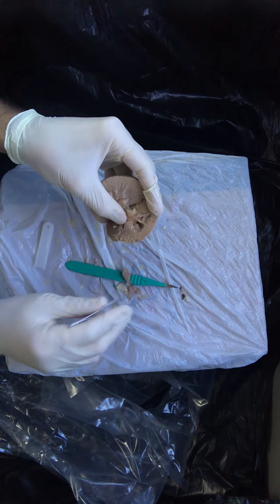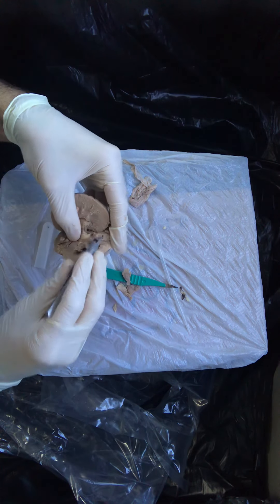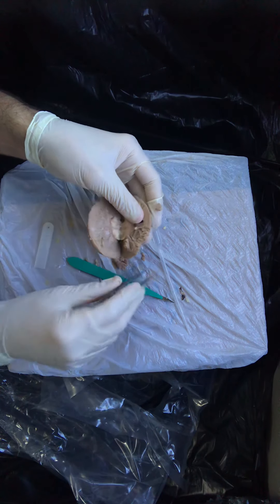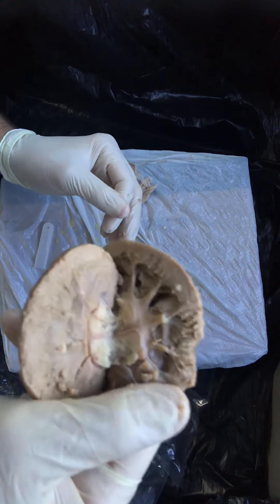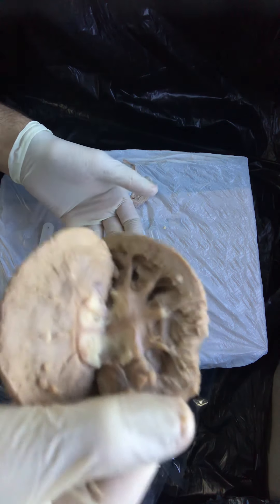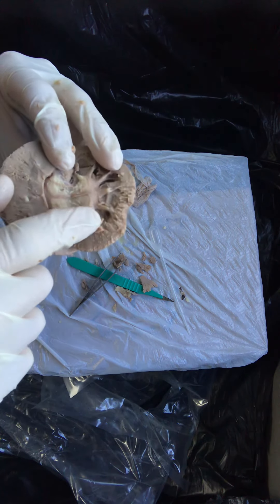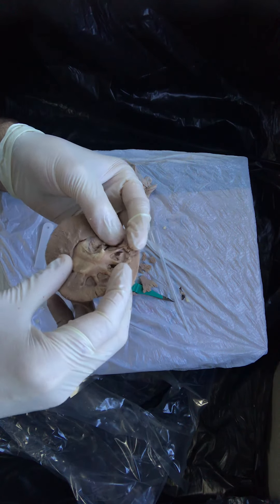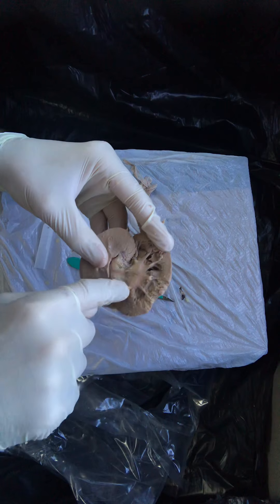Some of the pyramids and even some of the cortex — to expose the collecting system, just so that we can get an appreciation. You don't have to do this to yours yet if you don't want to mess it up, or maybe you can do it at the end. But I just want to show you how the collecting system of this organ looks — almost like an octopus or a star or something like that — with a central large hollow area and all of these radiating structures that are joining to form this larger renal pelvis.